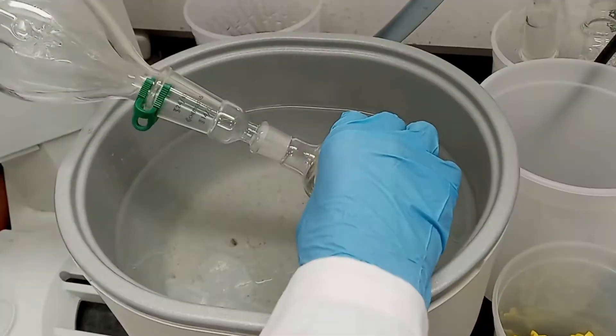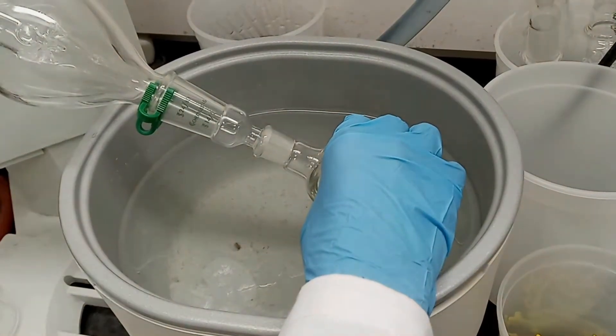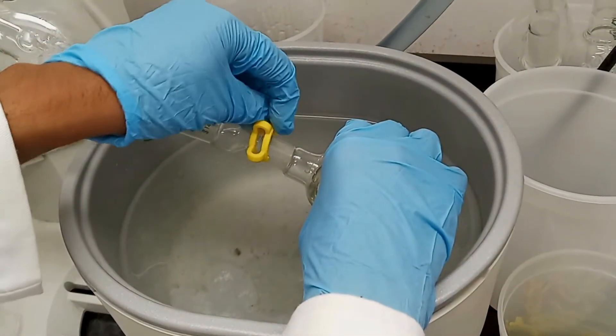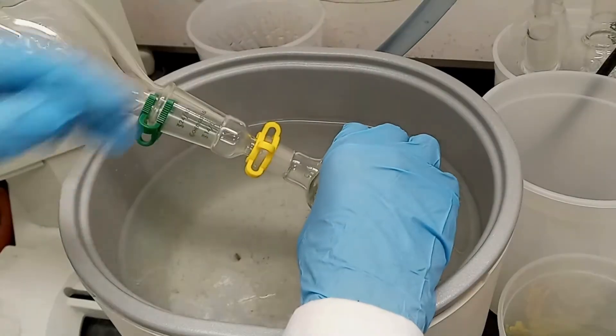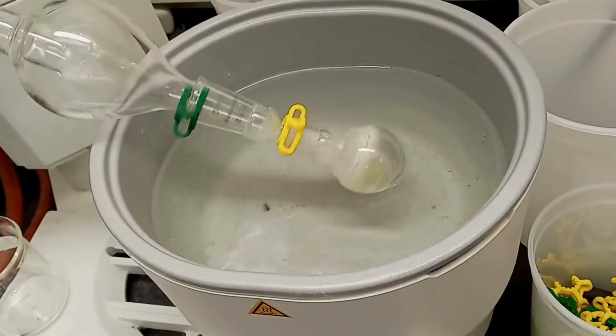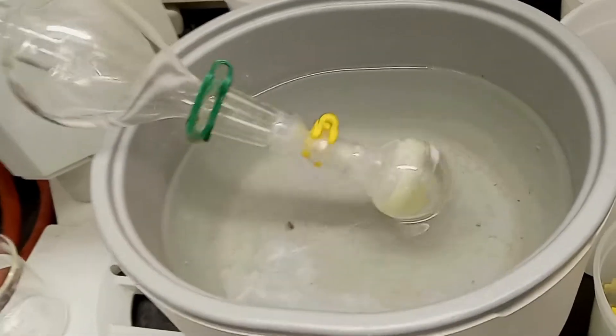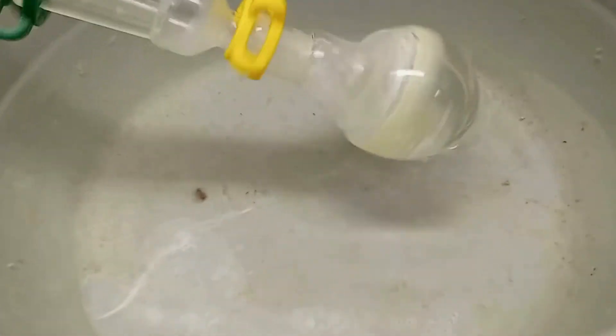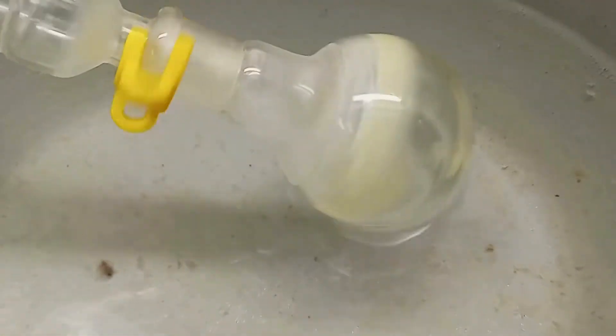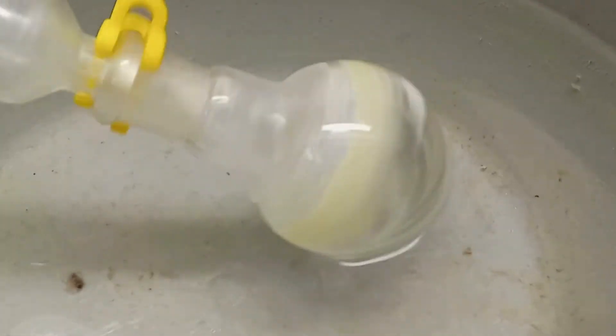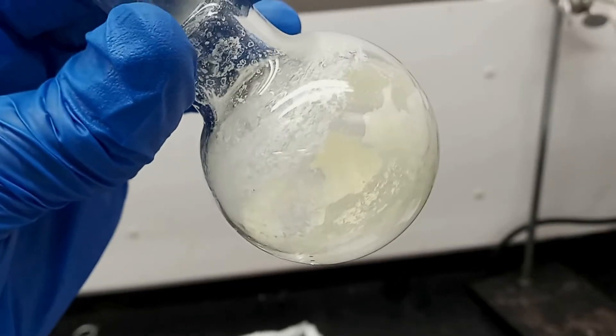Next, we used the rotovap. And this is what it looked like.